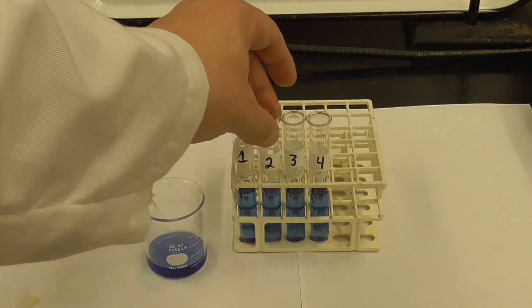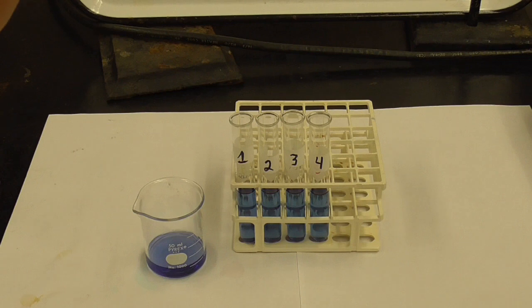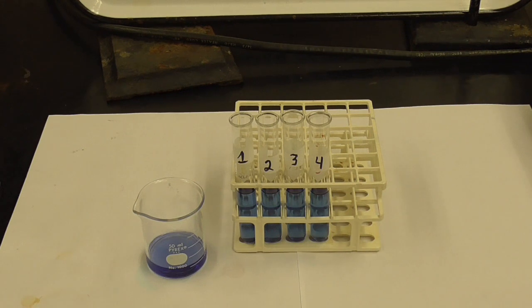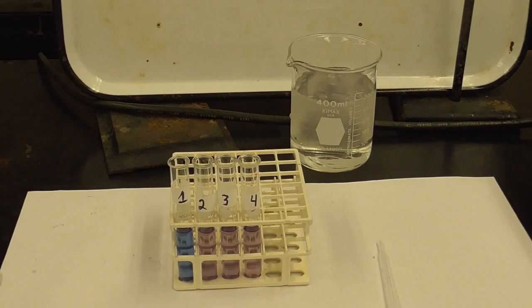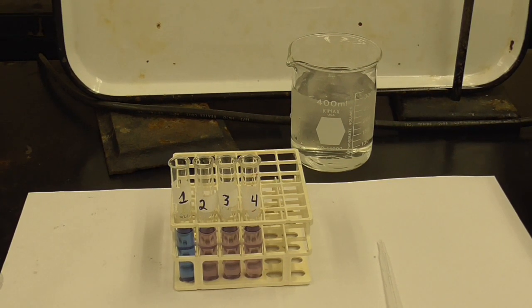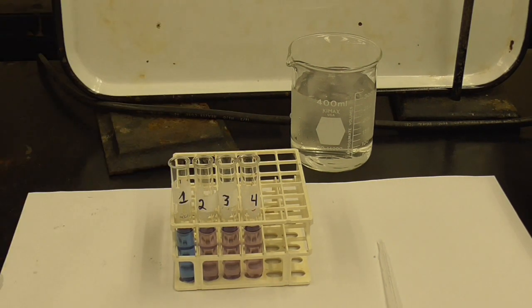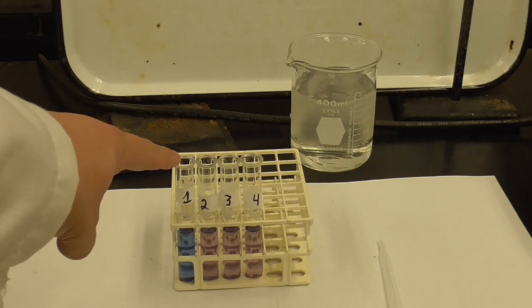And then we're going to know how much that is. We're going to add the same amount of water to 3 and 4, so we're going to try to get those all to lavender. I'm not going to record that, but we'll come back and we'll see that test tubes 2 through 4 are all lavender. Okay, so with the help of Dr. Velkamp, because I'm colorblind, I've got test tubes 2, 3, and 4 to a lavender color. It only took a couple of drops. So 1 is our control, so that's staying the same color, the ethanol color.